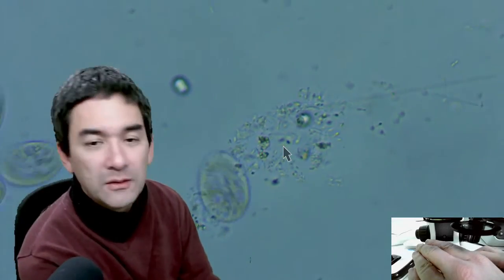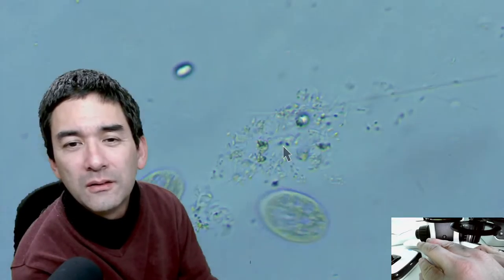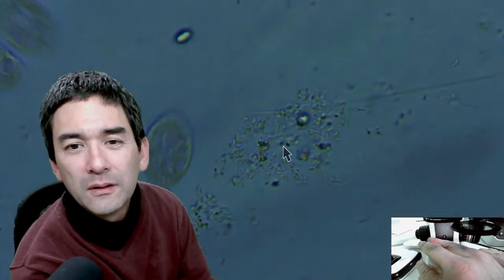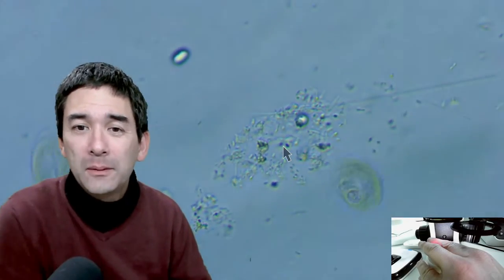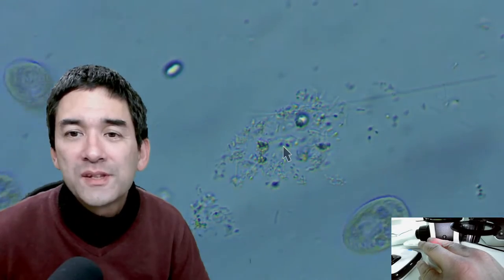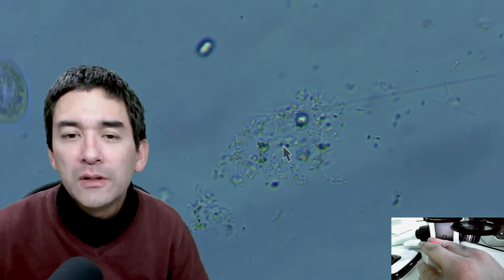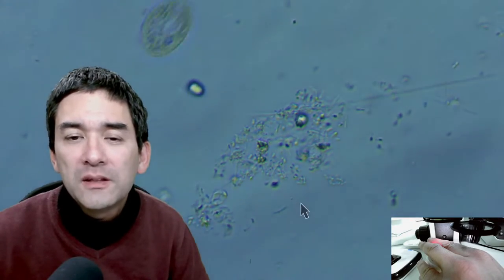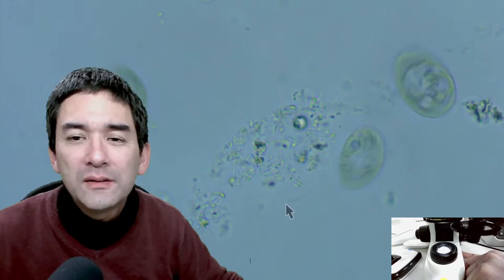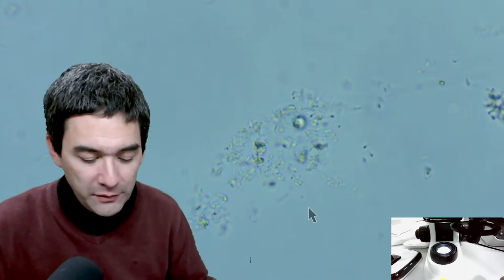Without the oblique filter, the image is bright. Now moving my hand over it — of course it becomes darker, but turning up the light you also get a slight oblique effect. The chromatic aberration is a little bit stronger, but you're able to see that there is more light coming from one side. Oblique illumination also sometimes makes bacteria more visible — you see these little squiggly things and lines here, these are all bacteria.